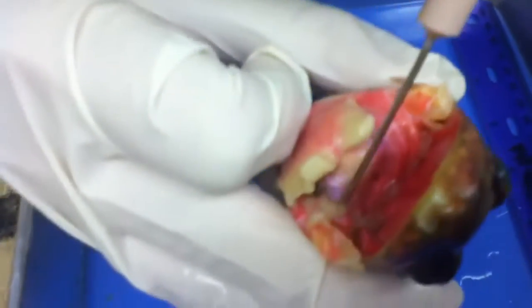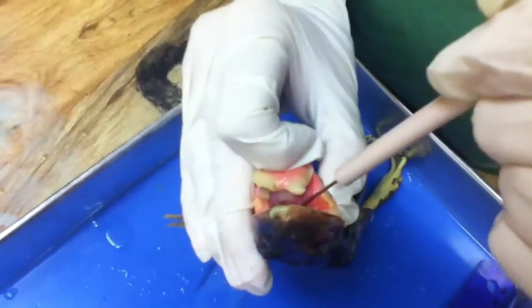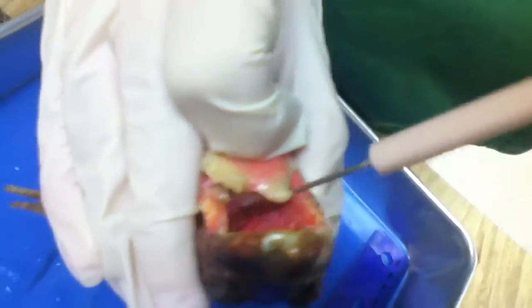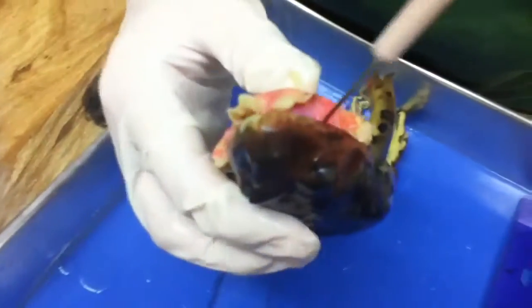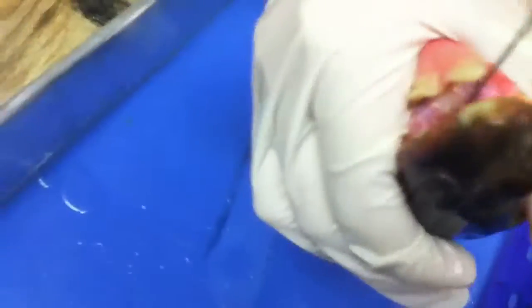Glottis — it looks like it's the back, back, back center. Do you see it? Is there something back there? There's a hole — you see it? The hole? I think that's where it is. Esophagus — his esophagus is right here that I'm opening. It's around the hole. I don't want frog juice to squirt on me. The frog juice won't squirt on you, just look. Right here — all around it. You can see that hole in there.